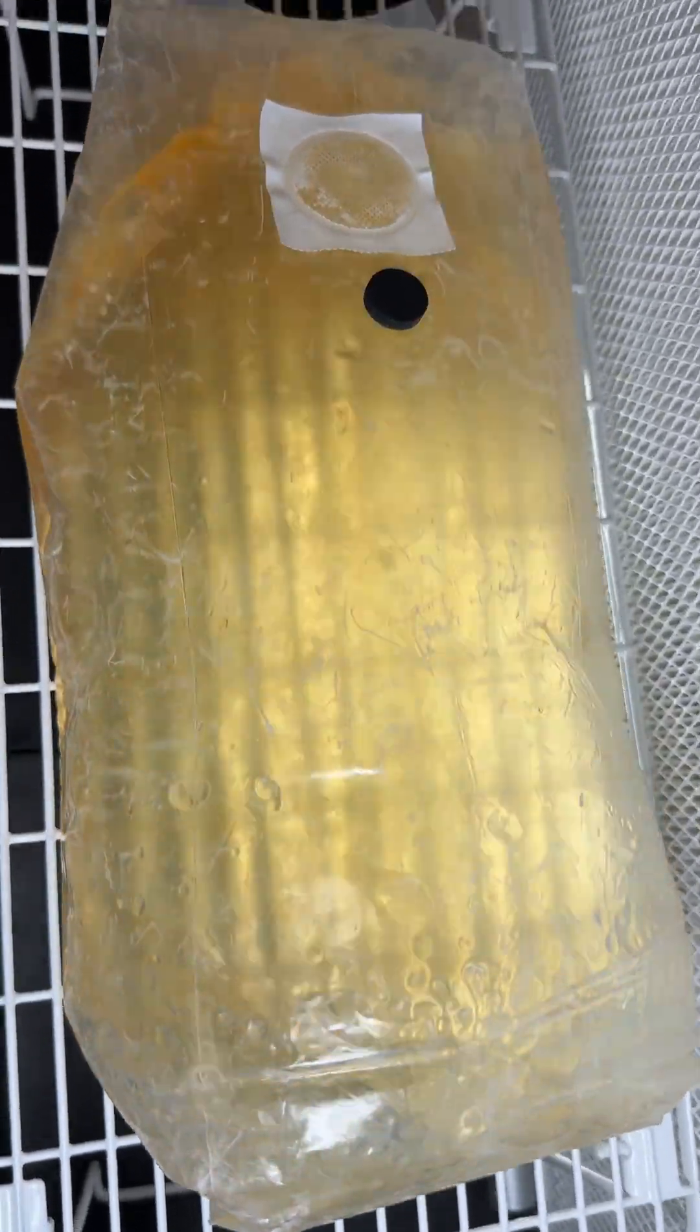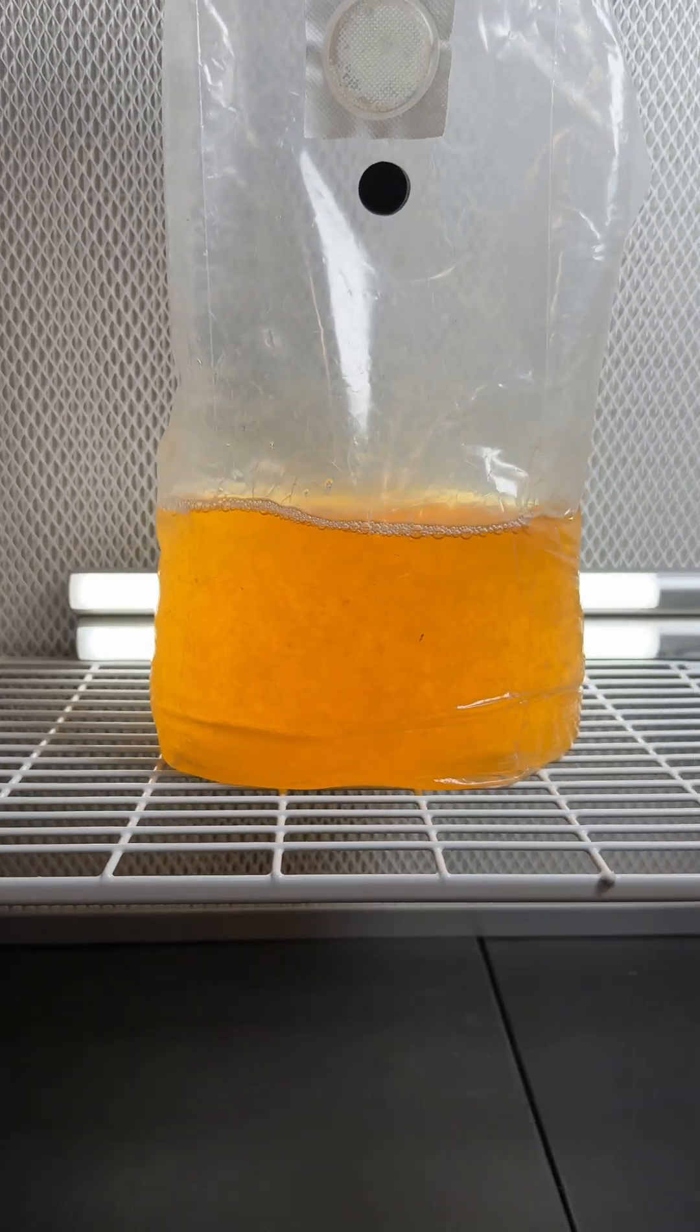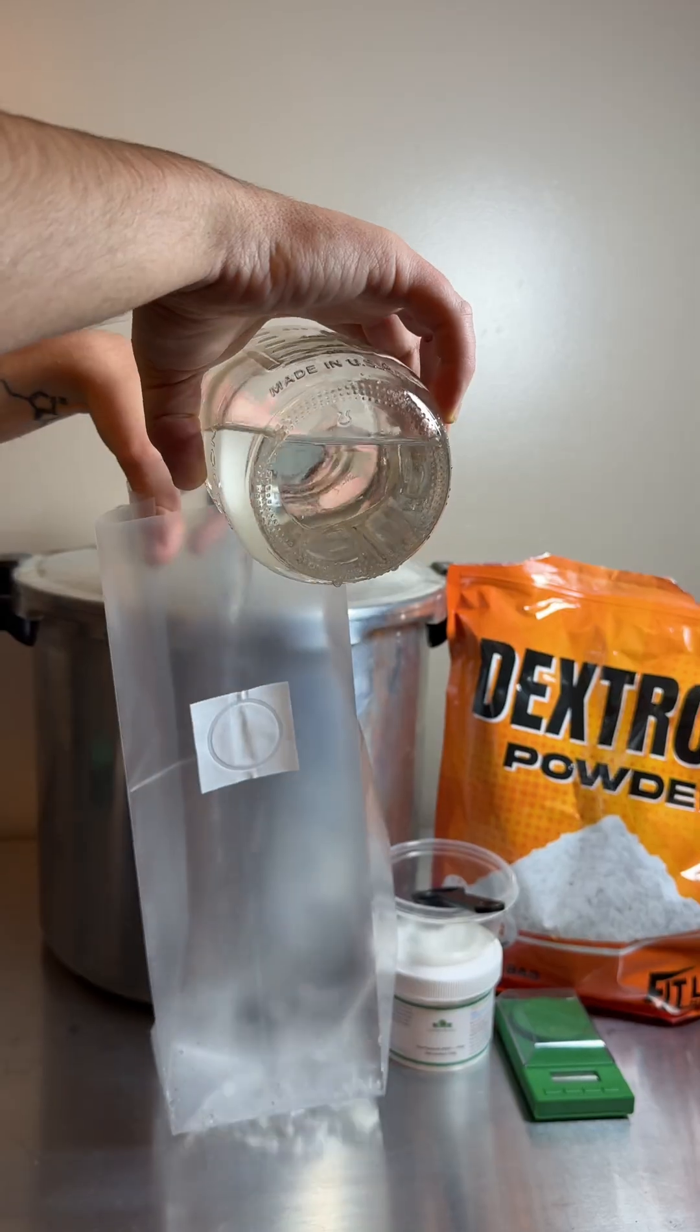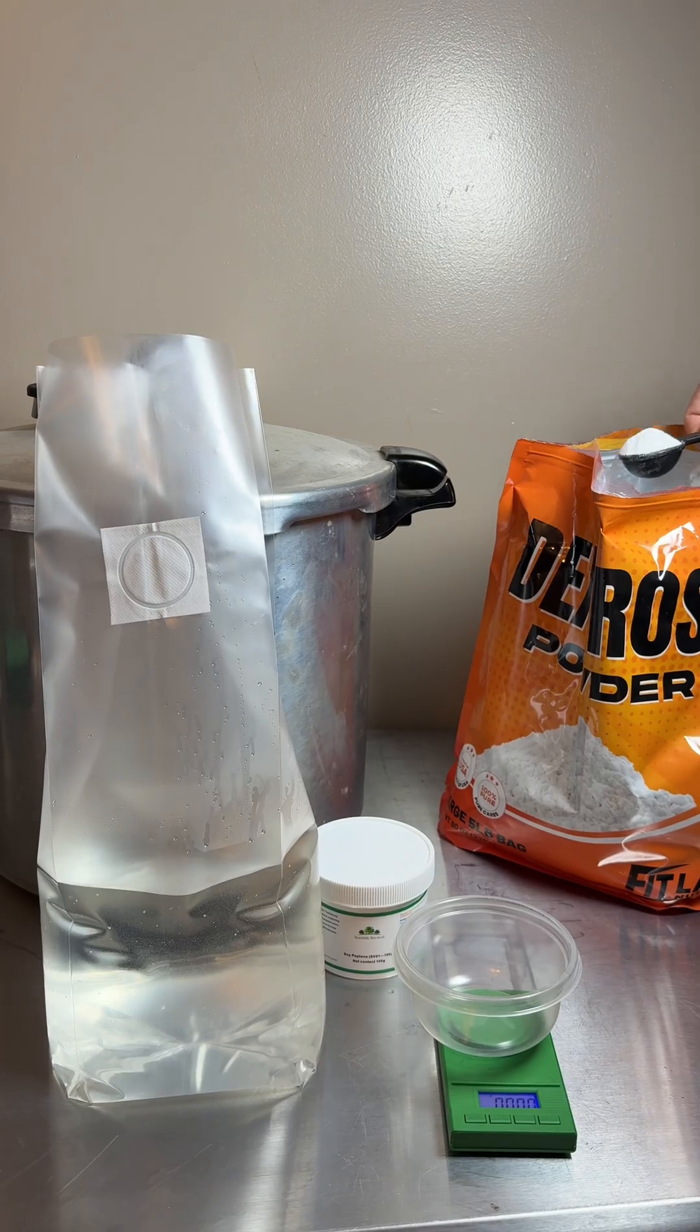This is my homemade mushroom liquid culture bioreactor bag. By using bags instead of jars, I can massage the liquid culture to break it up instead of using a magnetic stir bar, and it also takes up less space than jars.